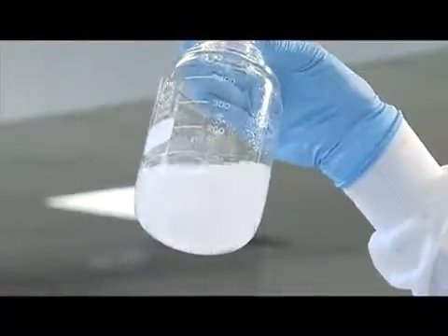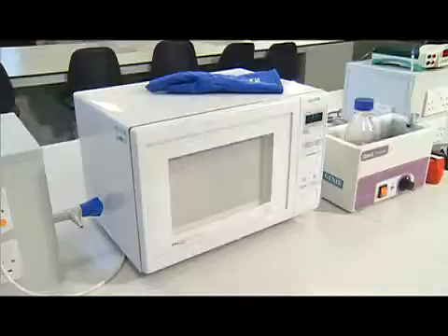The next step is to heat the agarose and buffer mixture in a microwave oven until the agarose is completely dissolved.